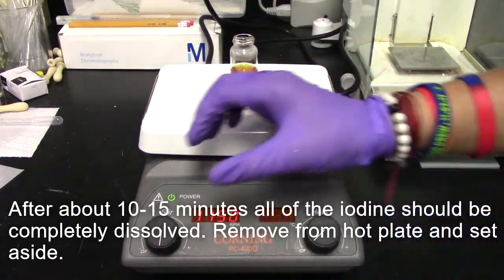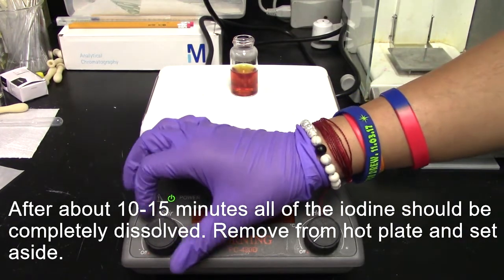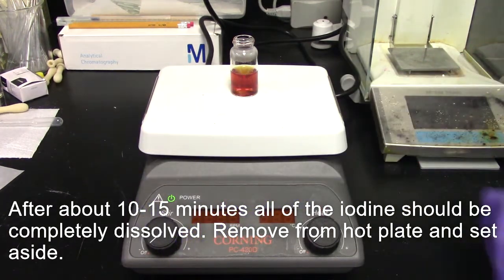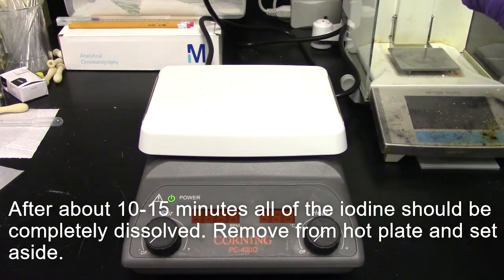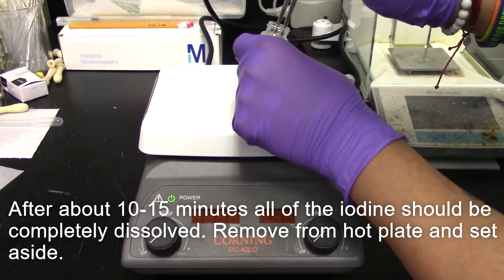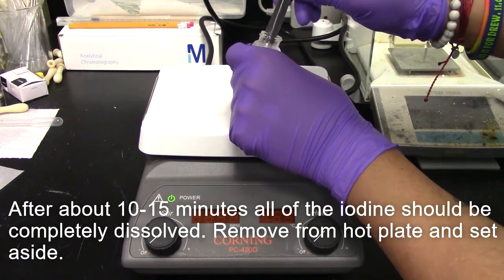After about 10 to 15 minutes, the iodine solution should be completely dissolved. Carefully remove from the hot plate and cover and set aside. Ensure to remove the stirring bar.